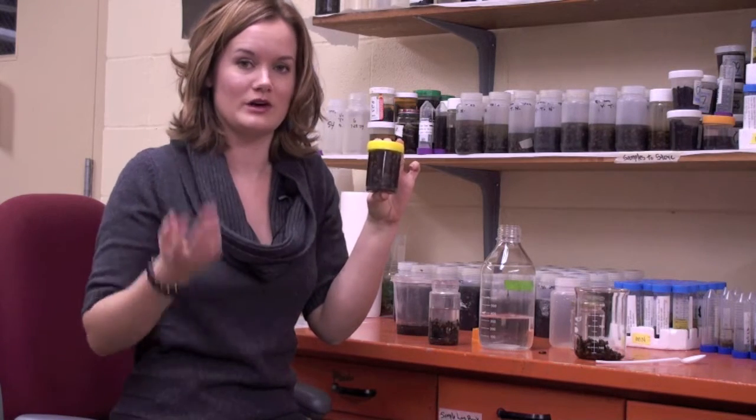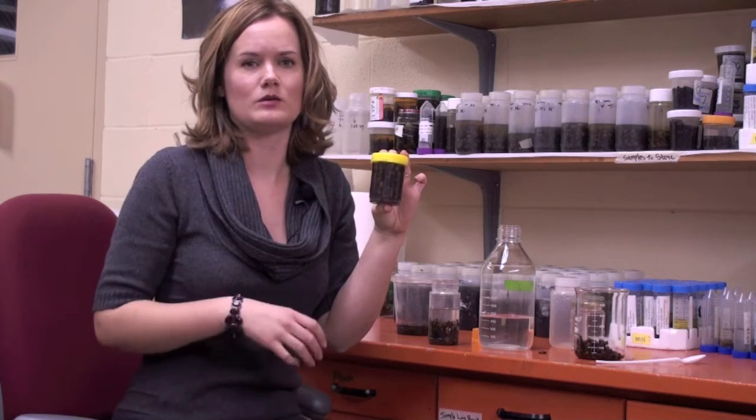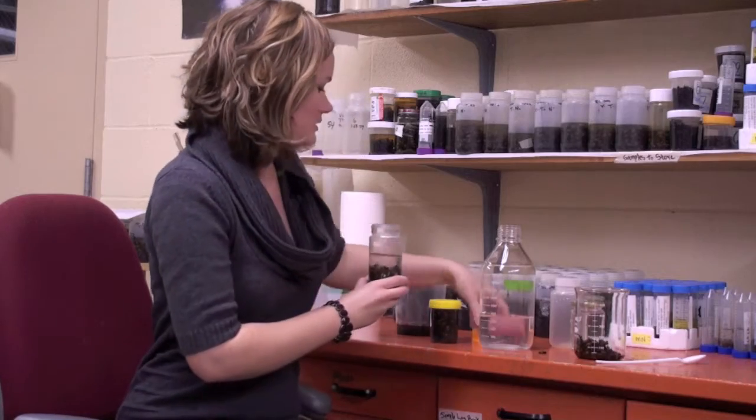And if the bees soak up all the alcohol, then the bees are rotten, and your data will not be quite as accurate. So it's really important, as I said, to have it filled like that.